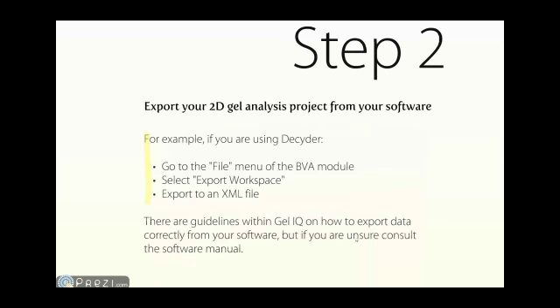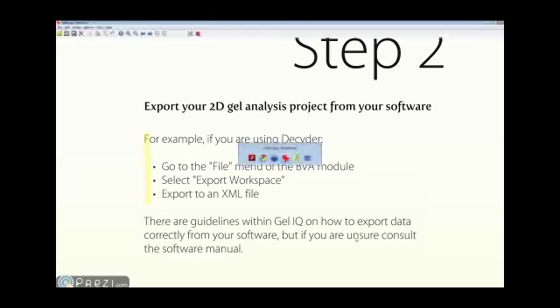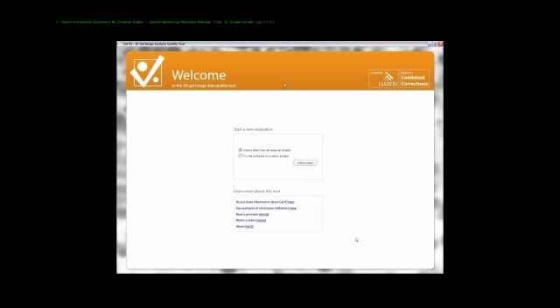The next step is, of course, to import the data file from the software that you use to produce the image analysis data. And here I'm going to switch over to some screenshots from GelIQ instead of using this presentation, so just bear with me for a second. This is what it looks like when you open up GelIQ. It's a welcoming page where you are asked if you just want to try the software on a demo project or if you want to do it on your own data from an external project.